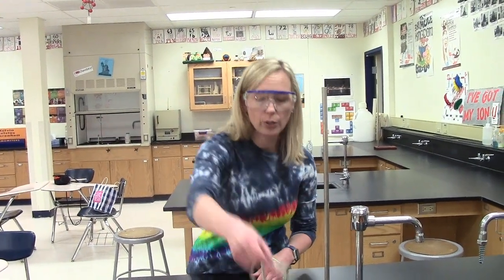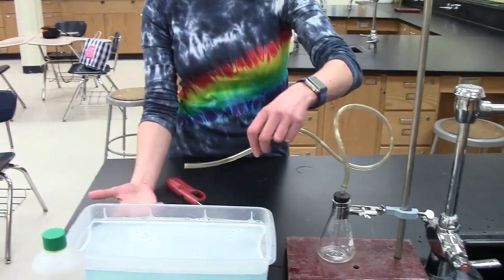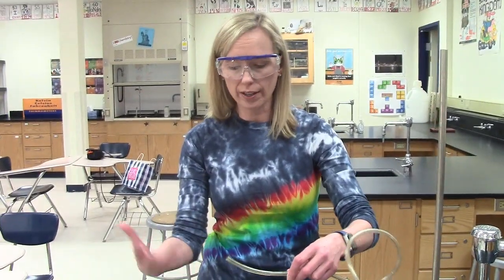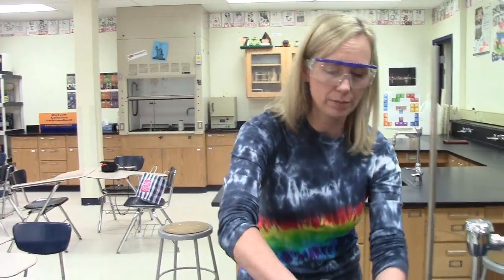So what I'd like to do to kind of spice this up a little bit is as the hydrogen gas is produced, you'll notice that I've got some tubing. And I'm going to thread the tubing into some soapy water. I just put some Dawn soap in there and added it to water, and I'm hoping I'm going to get some bubbles. And if this really works, then I'm going to light my flammable hydrogen bubbles, and you'll see what happens. So let's get going.